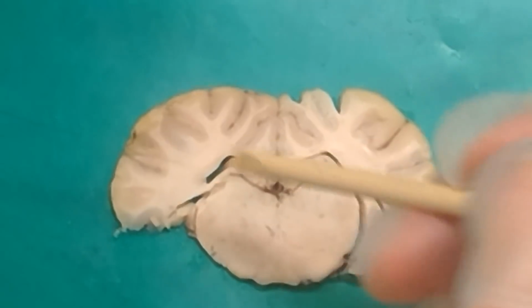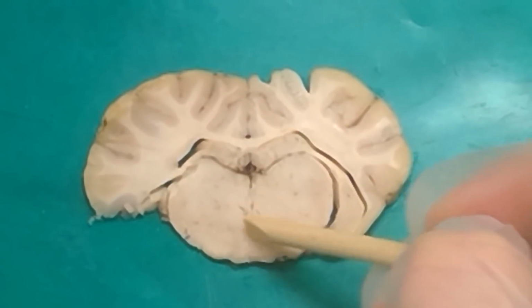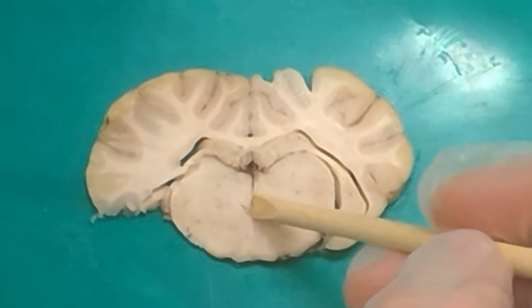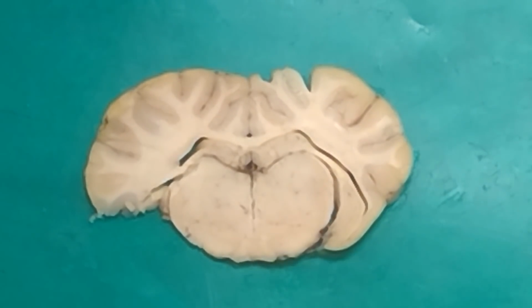But if you can see that there's third ventricle towards the top, there's third ventricle towards the bottom, there's not really any ventricle in the center, that's when you're at the massa intermedia, which you can see a little more clearly on a coronal cut that it's definitely connecting both sides. So we could definitely ask the massa intermedia on a coronal cut where there's a pin that's just right in the center. You'll be able to see third ventricle above and third ventricle below. And it'd be like, name these fibers, name the structure that's interrupting the third ventricle.